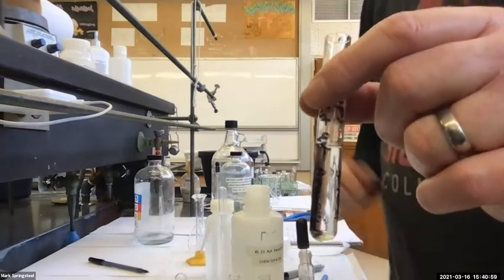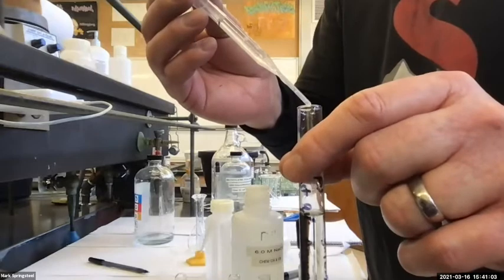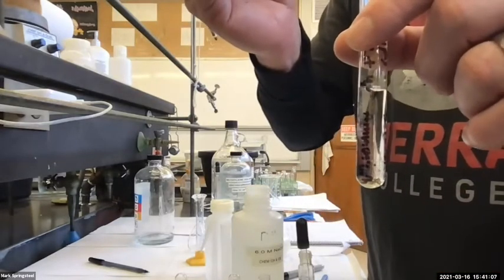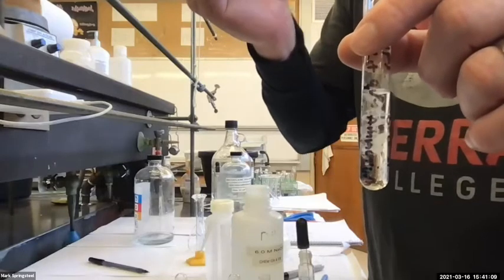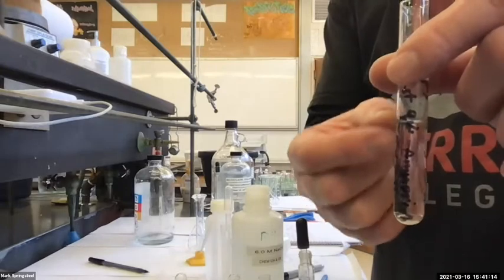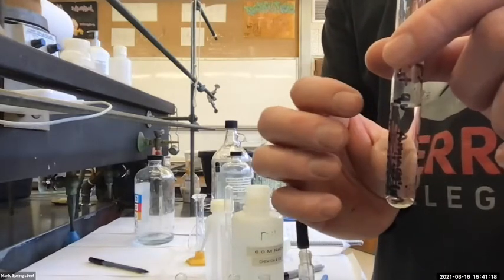Well, there's a precipitate forming, but then it's reacting with the excess acid in the solution that's contacting it, and it's going away. As the concentrated 6 molar hydroxide comes through, it creates a little local environment of basic solution.